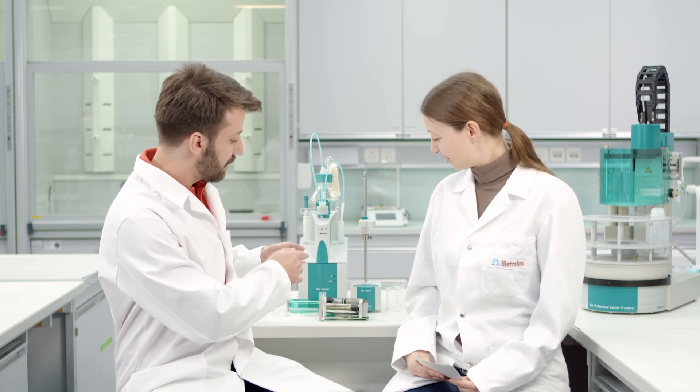How do I recognize that it is time to exchange the burette and don't end up with this? In this case here, you can see clearly that you cannot use this anymore. But on a daily basis, you cannot see it coming. So we recommend you to do a burette calibration where we can get the real values of the burette and you can also assure with that the quality of your analysis.